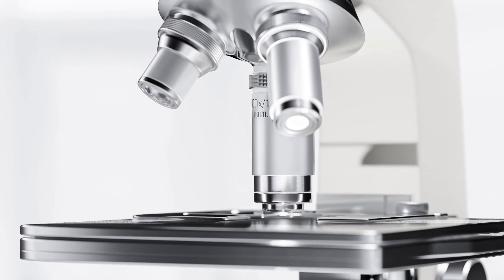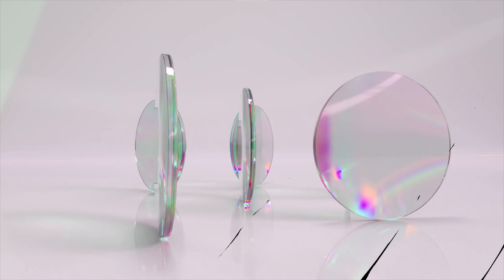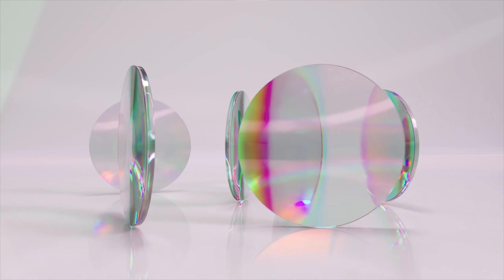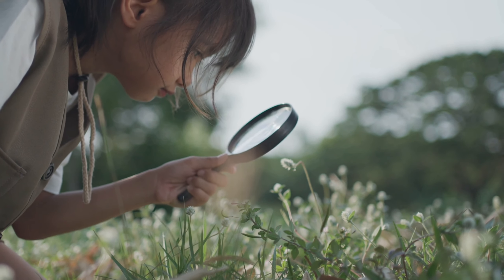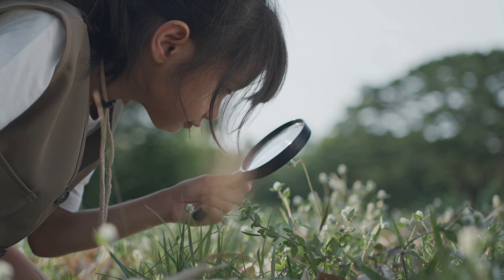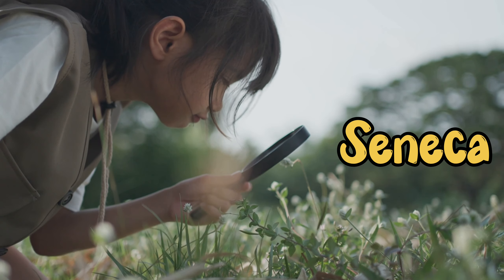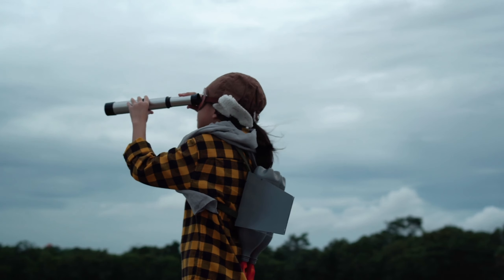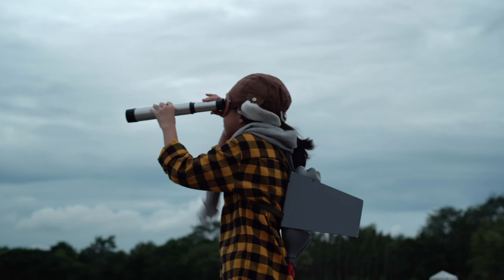Let's embark on a journey from its inception to the latest advancements. The story of the microscope begins with the invention of glass lenses. These magnifying glasses were used to view small objects and were mentioned in the writings of Roman philosophers Seneca and Pliny the Elder in the first century AD. The earliest simple microscope was a tube with a plate for the object at one end and a lens at the other — these were known as flea glasses.